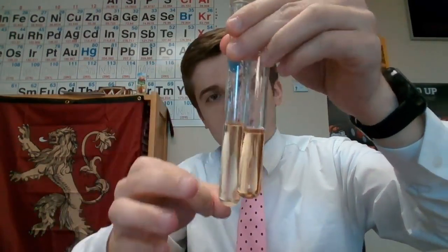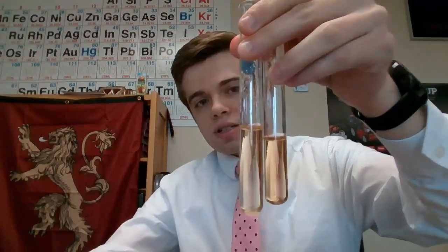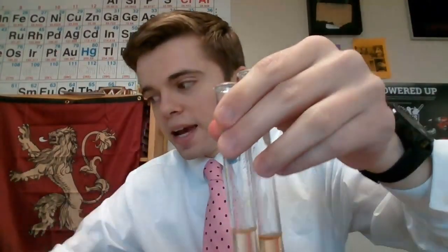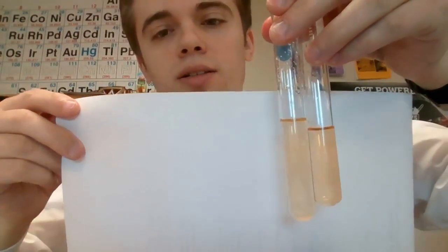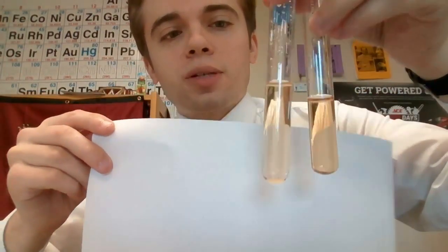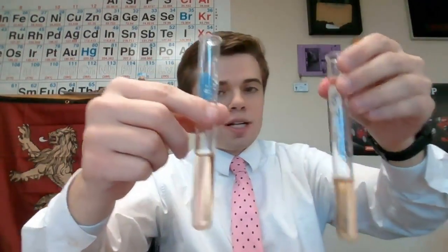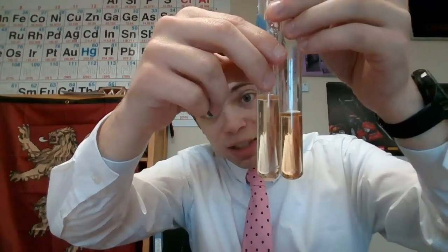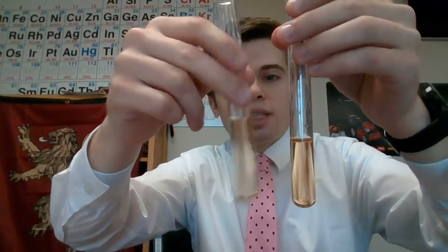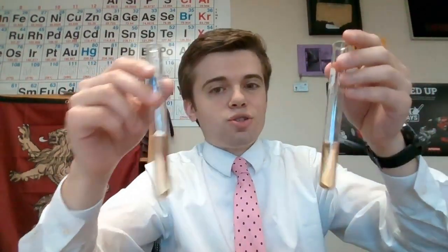I want you to see if you can tell me what happened here. Let me see if I can put a white background on this so that you can see it a little better. Can you tell me what way equilibrium shifts? So this one over here is the one that we added our solid potassium chloride to, and this is our control. So what do we see? It's a little bit lighter. It's kind of hard to tell, but it is a little bit lighter. I want you to say what way did equilibrium shift whenever I added this to our solution?